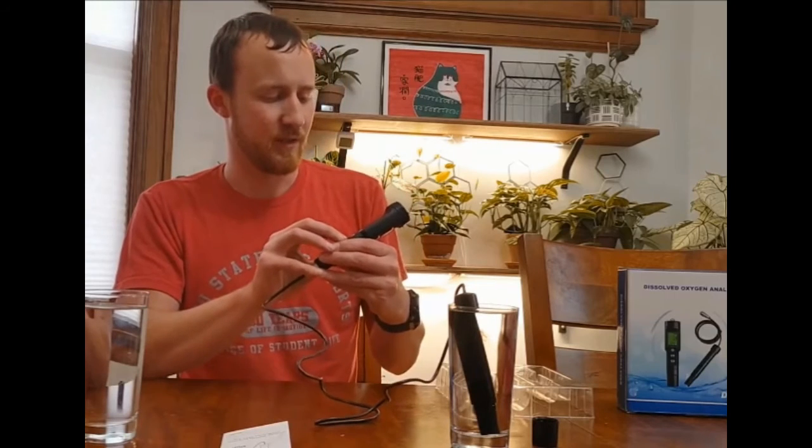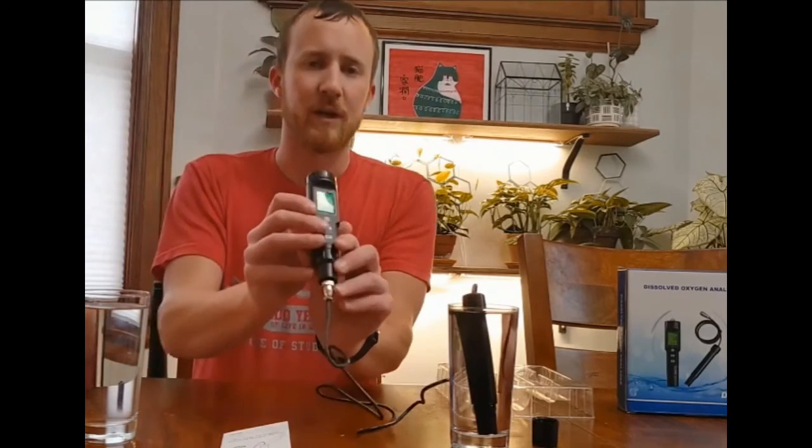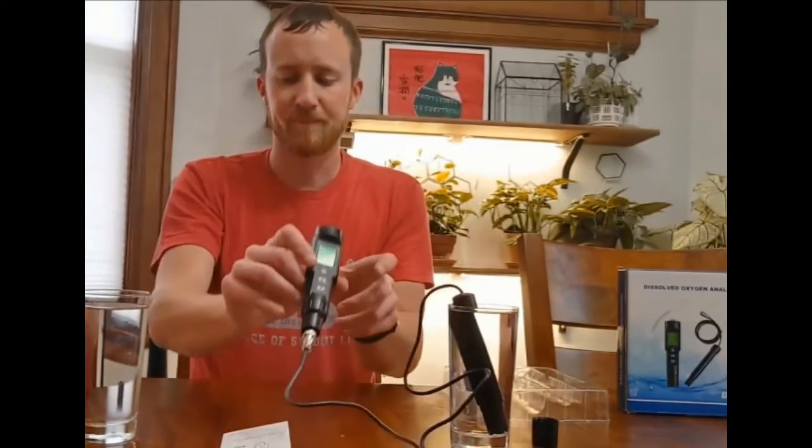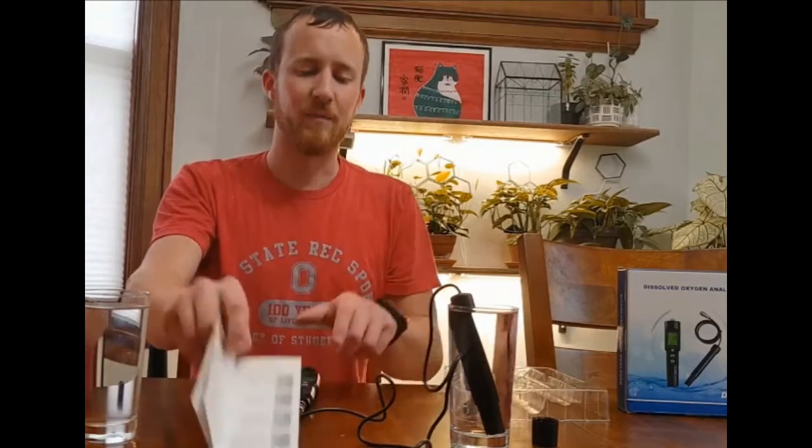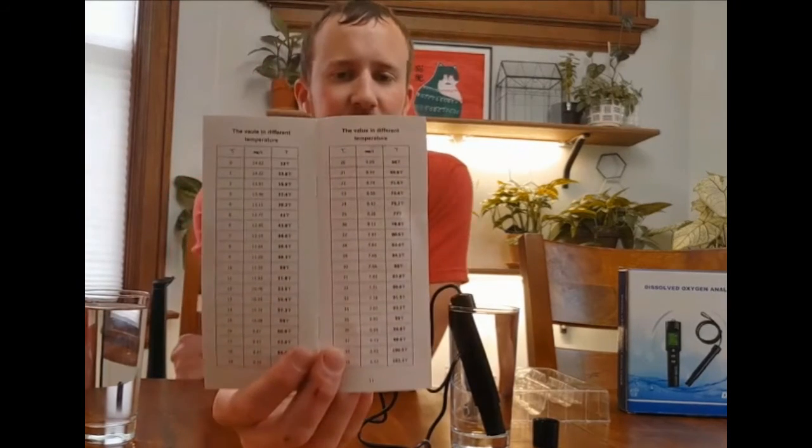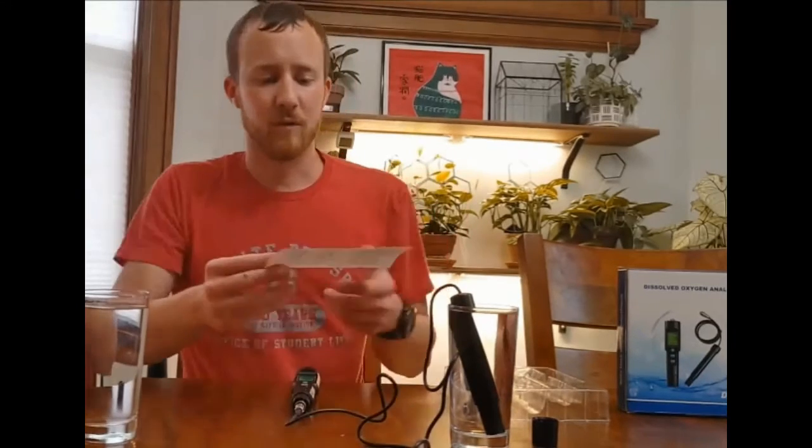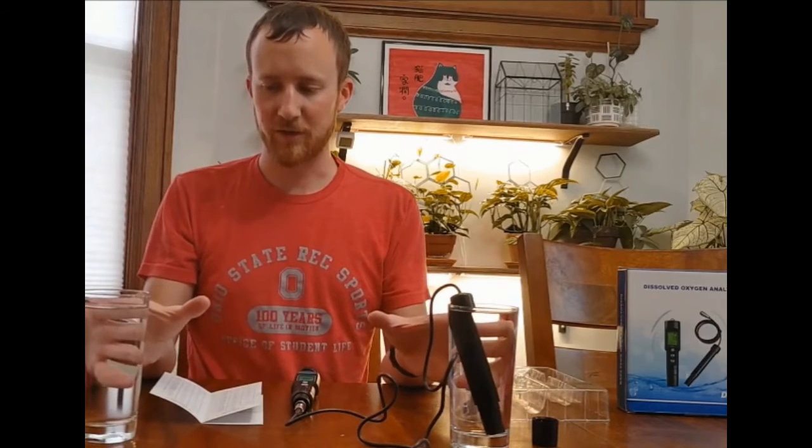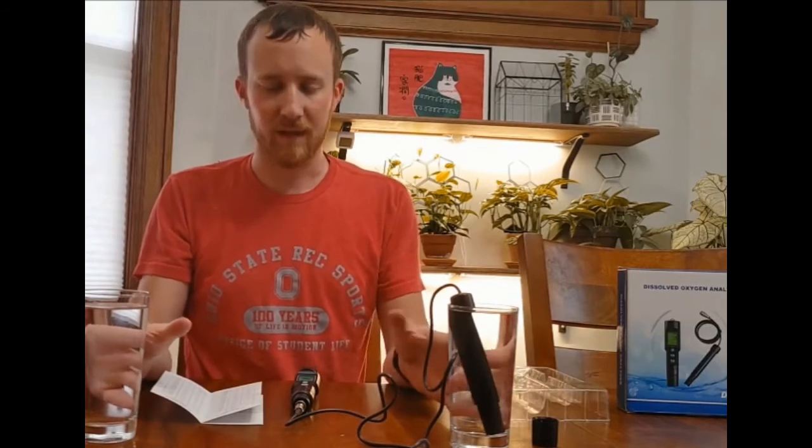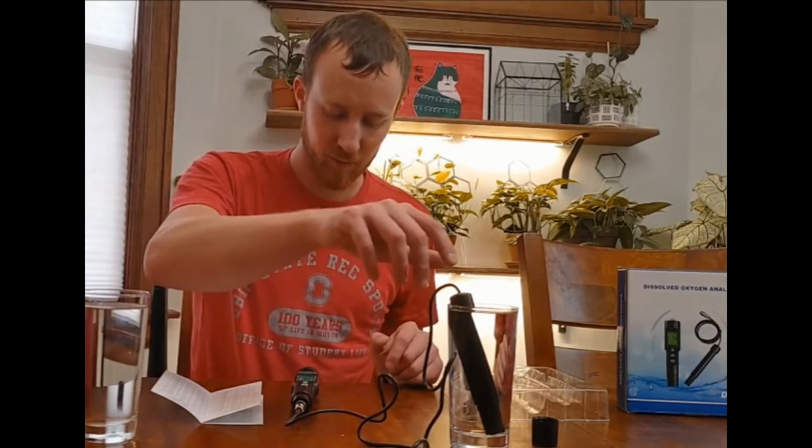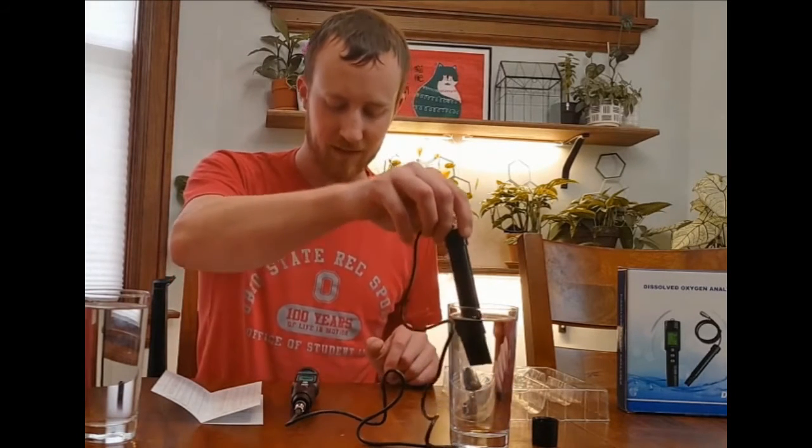Additionally, you want to look - let me hit a button here to switch it. You'll want to look at the bottom here because it does measure the temperature of the liquid it's measuring. On the back of the booklet, it does have a conversion table. You will need to convert the actual measurements of the different liquids. I think these are at different temperatures.